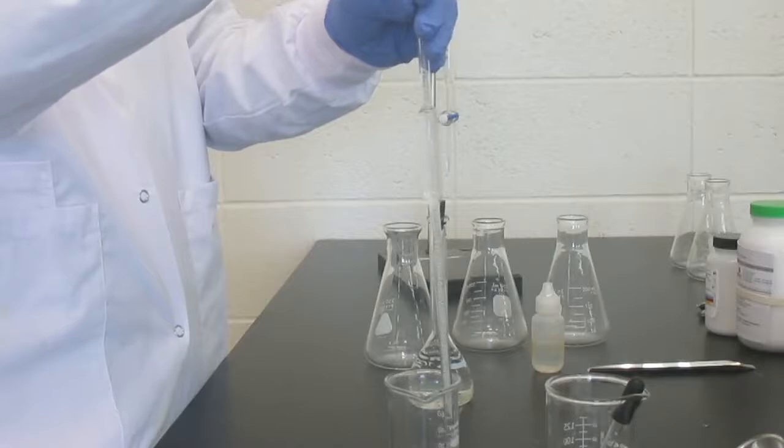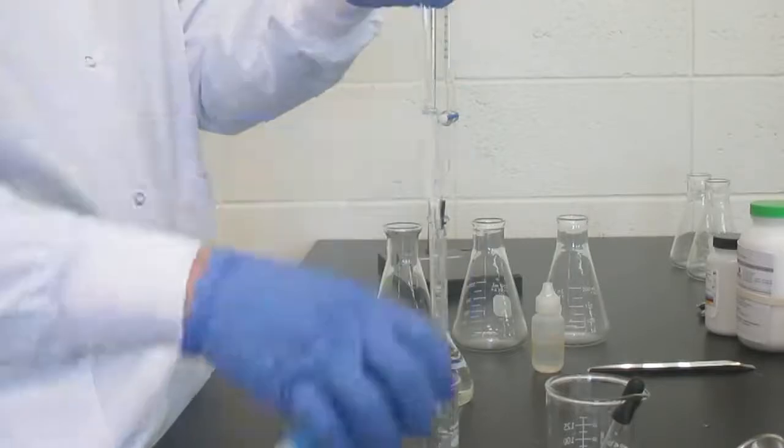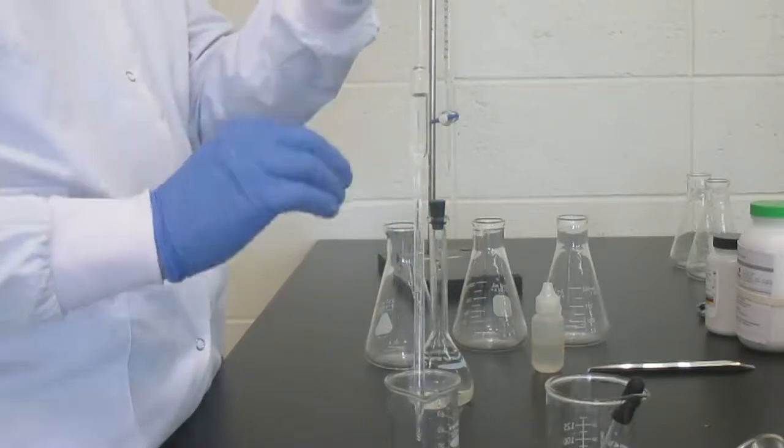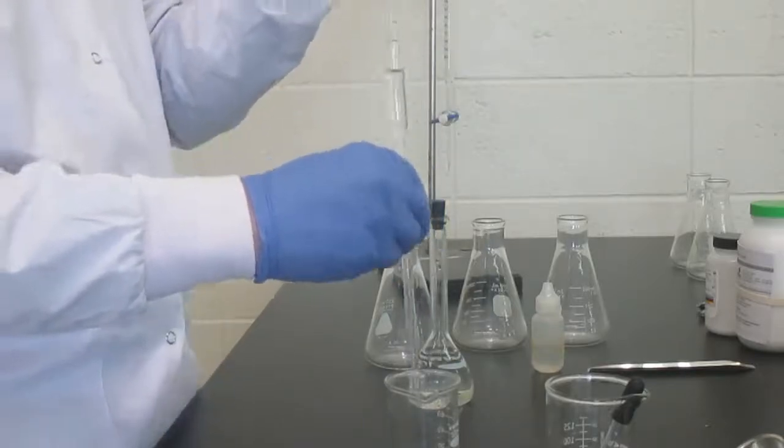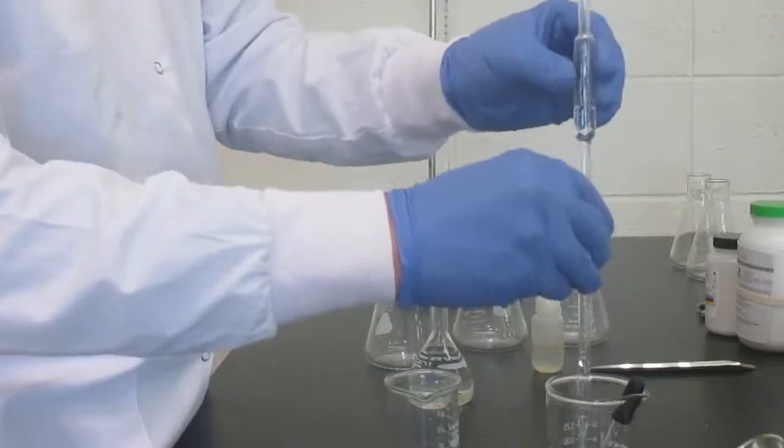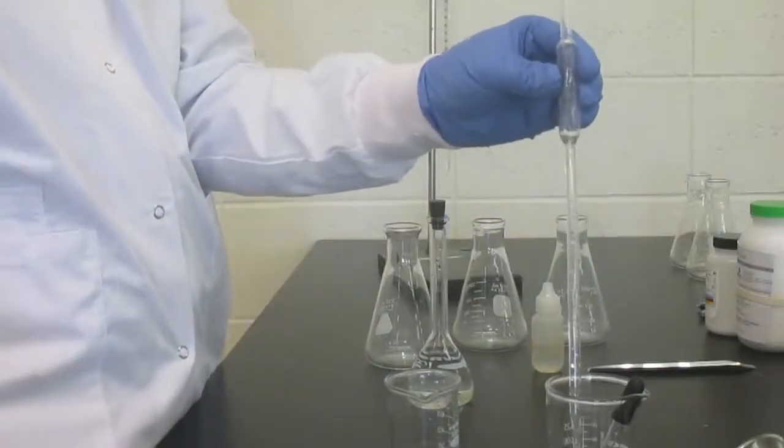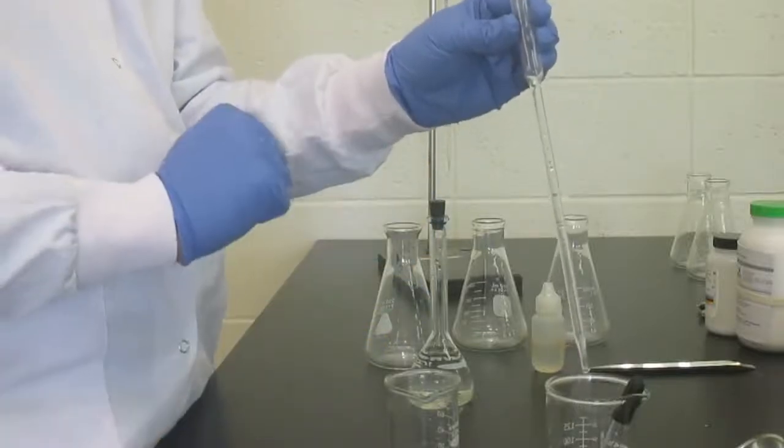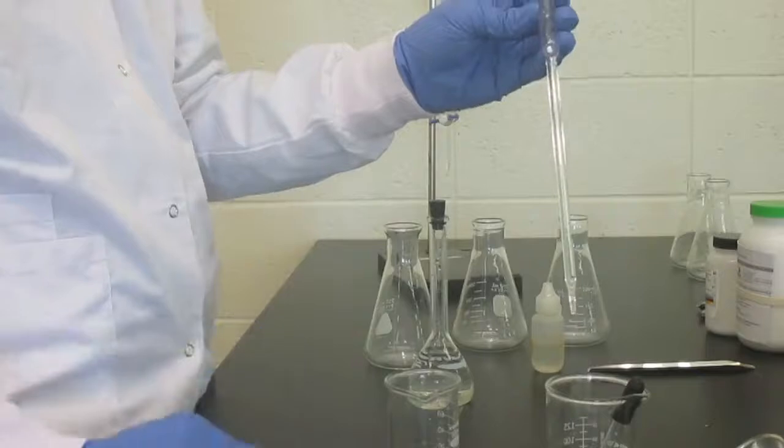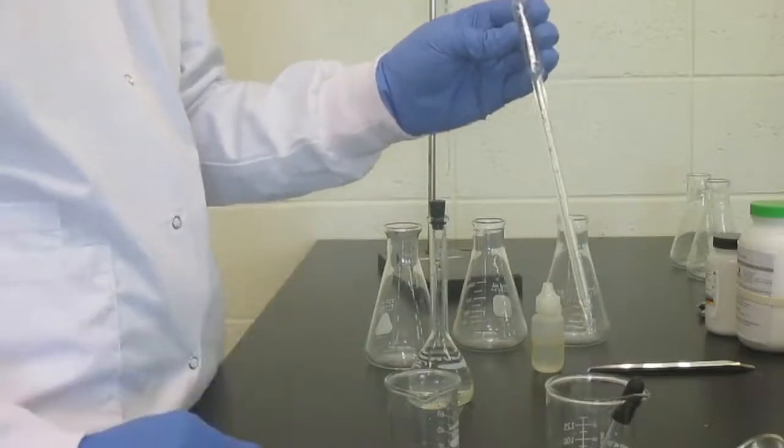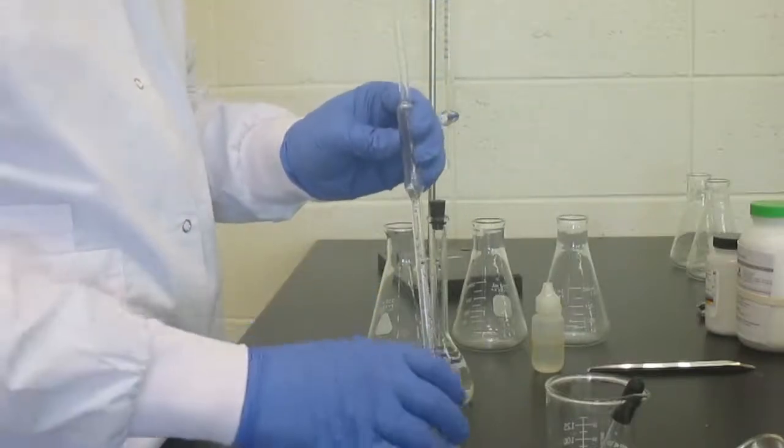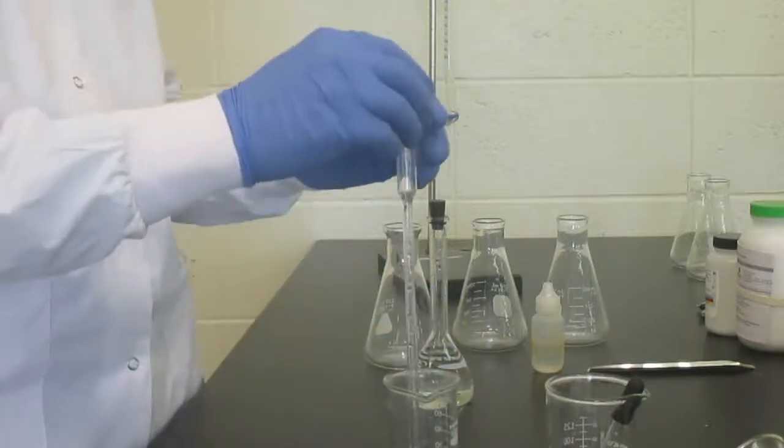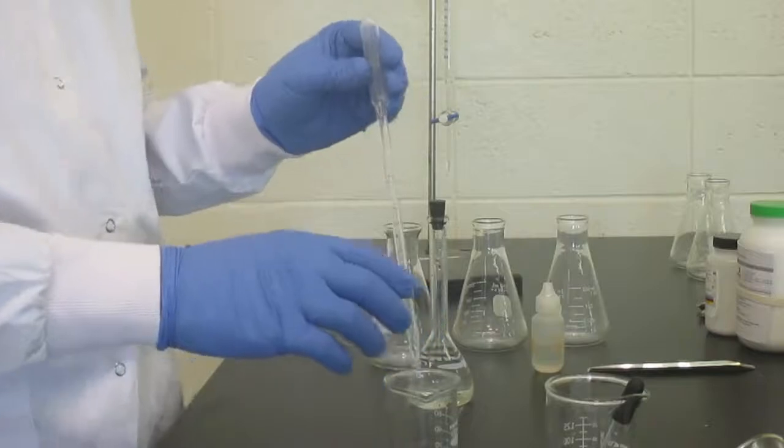The reason for this is we don't know what was last in this pipette and we want to make sure it's perfectly clean, that there's no residue in there that could react with our acid. By sheeting it, we're making sure that anything that will react has reacted. Any droplets in there are KHP solution. For example, even the little bit that's left in the tip, we now know that's KHP solution. We have dipped the tip in a small sample of KHP before we dip it into our volumetric flask, which has pure solution in it. So now we are ready to actually pipette 10 ml samples.